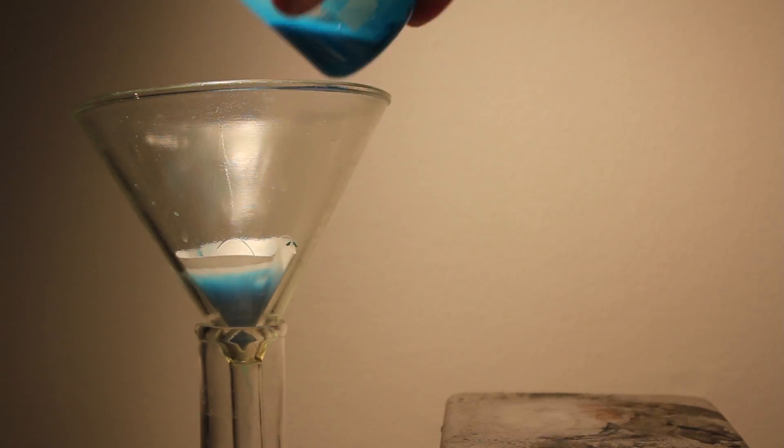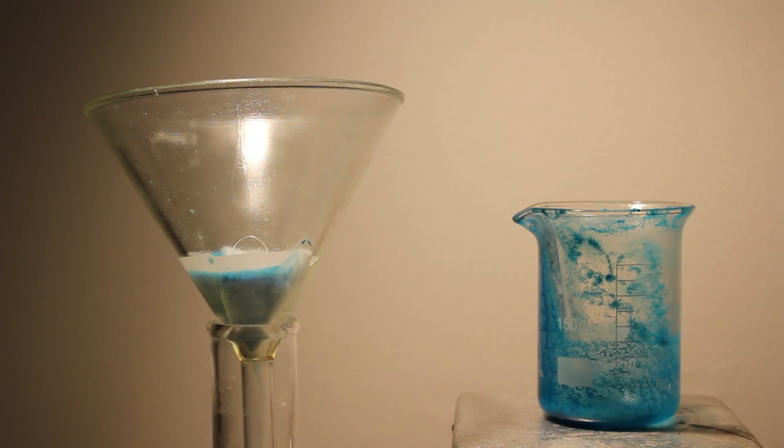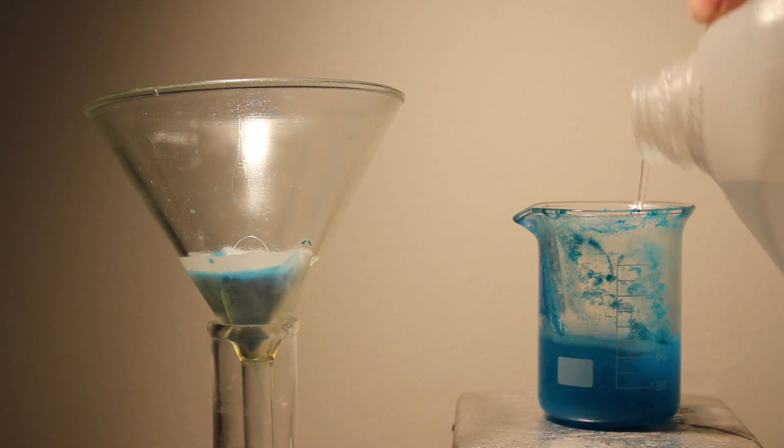This should then be filtered. The beaker should then be washed with water and re-filtered.